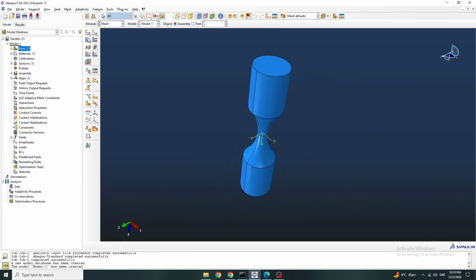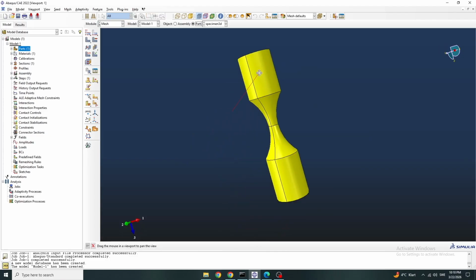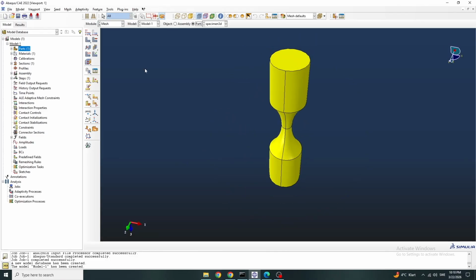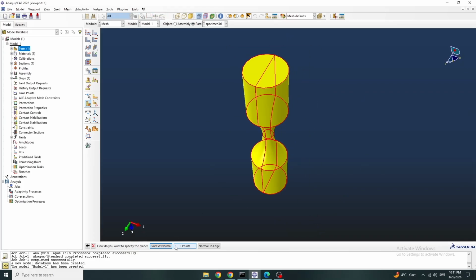So, mesh it. We want to make the part green, it's better that way. So maybe partition with 3 points: 1, 2, 3, and another 3 points: 1, 2, 3.